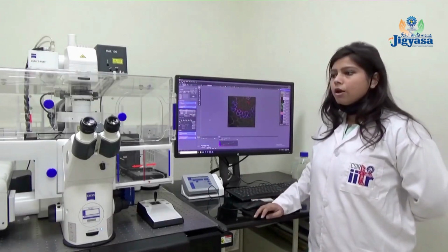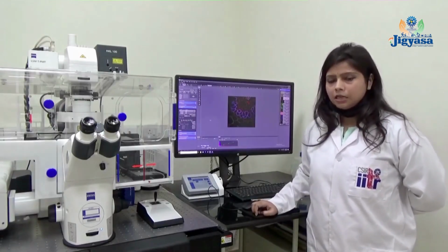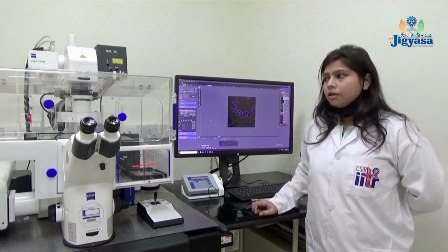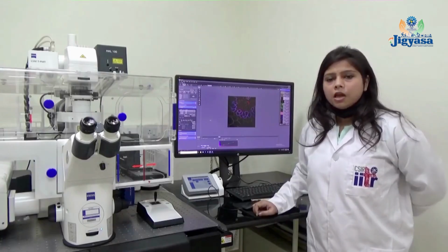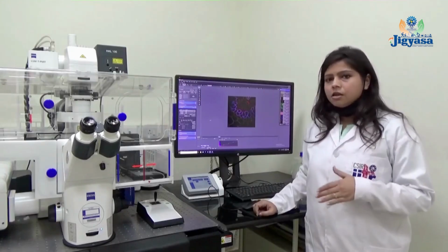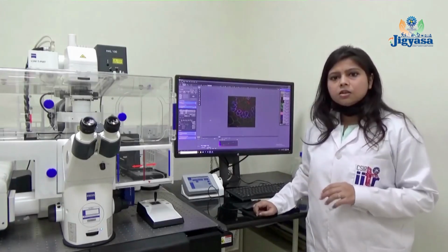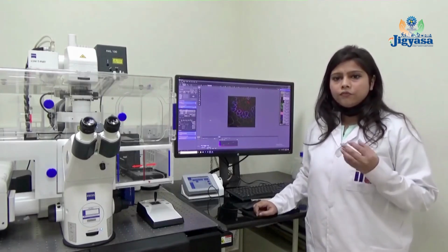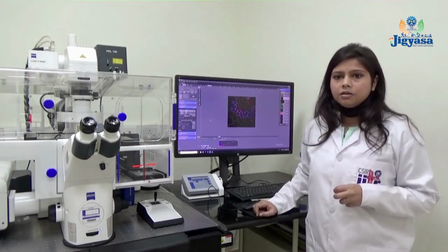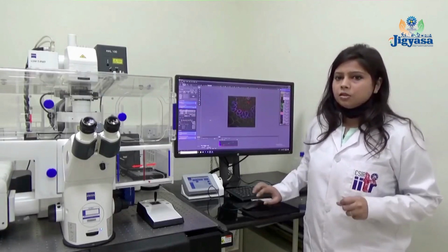This confocal microscope captures more specific and precise region images because it uses laser sources as an illumination source, and it contains 2 pinhole apertures. The first aperture is after the laser lines, which specifically illuminates the specific region of the sample, and the second pinhole filter is located before the detector, which cuts out the out-of-focus light, so we get the specific region images very appropriately.